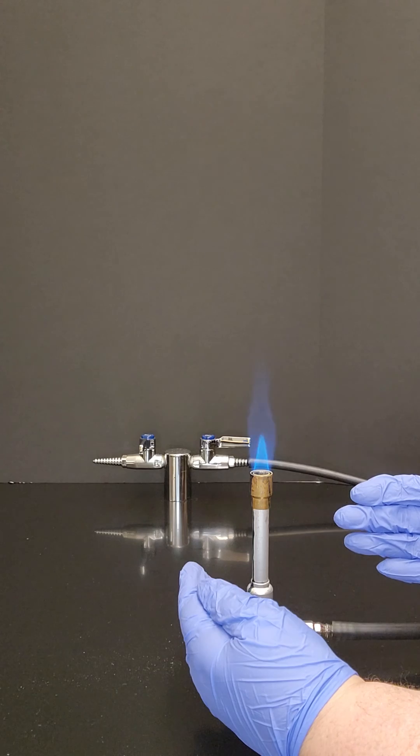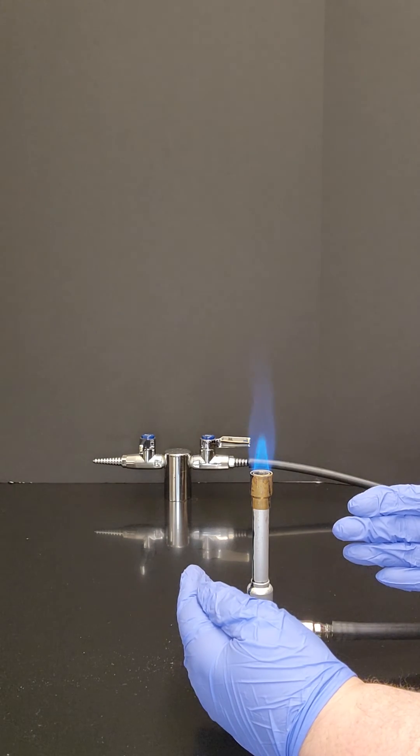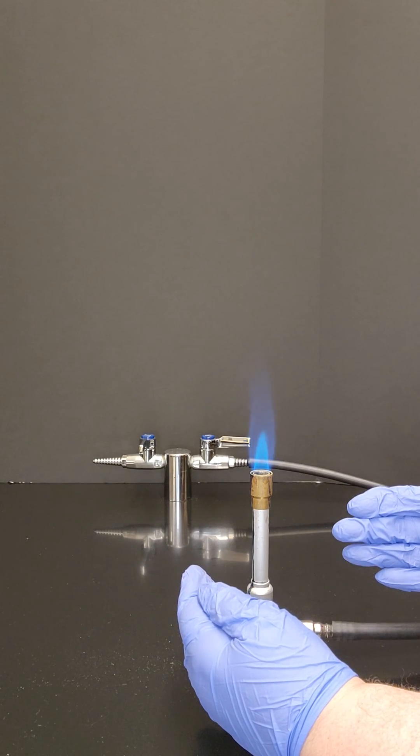Whenever it's adjusted properly this is the kind of flame you should see. This is what you'll want to use in your micro lab.